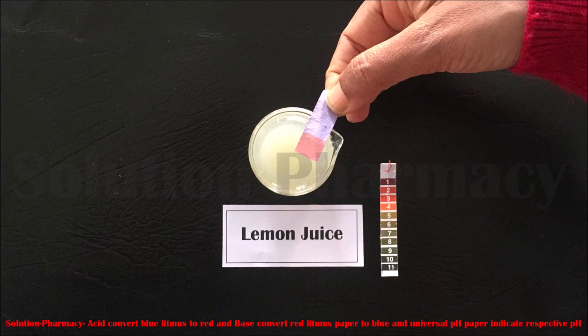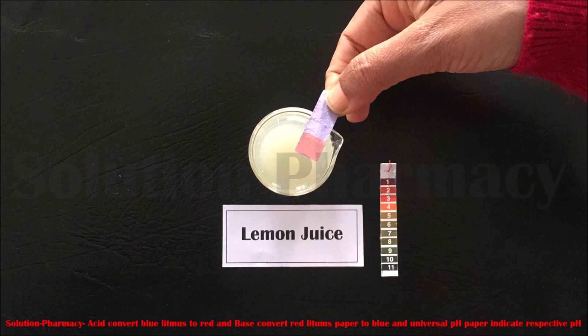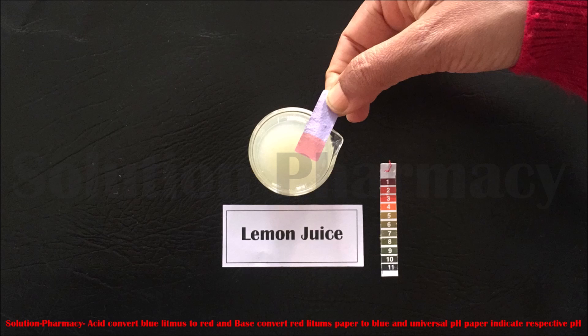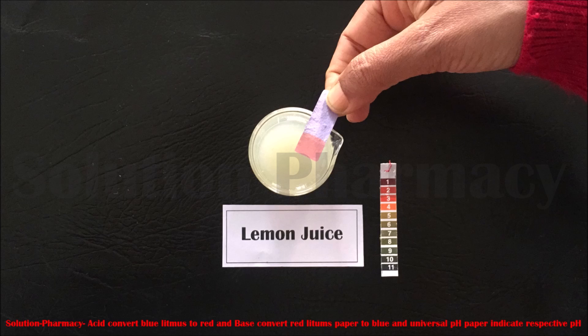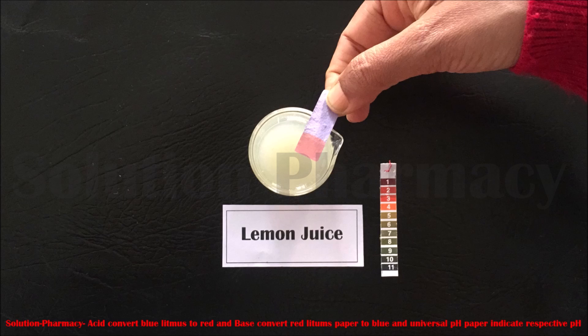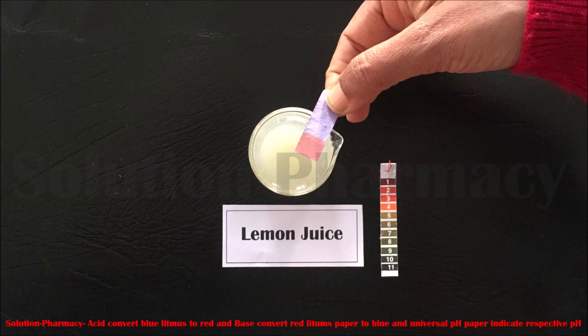Hello friends, welcome to the channel Solution. Today in this video we will show you how to determine the acidic and basic nature of any solution using litmus paper, and also how to determine the pH value of any solution using universal pH paper. First of all, let's understand what acidic or basic nature of a solution means, and what pH is.